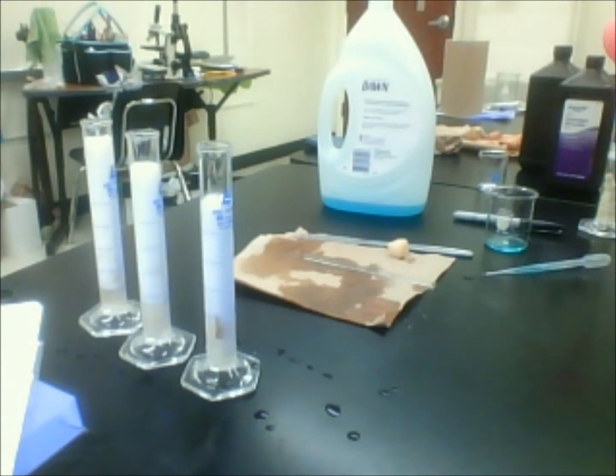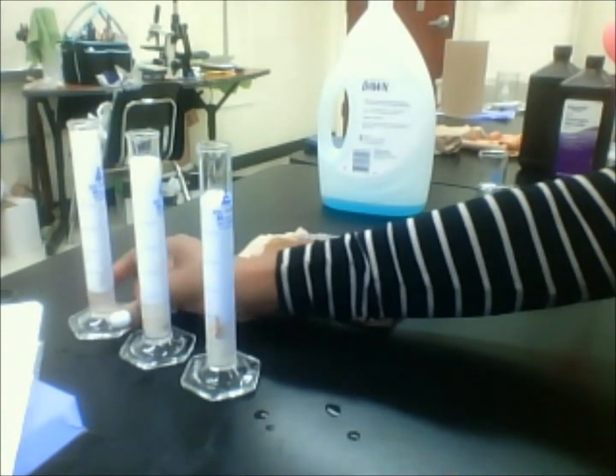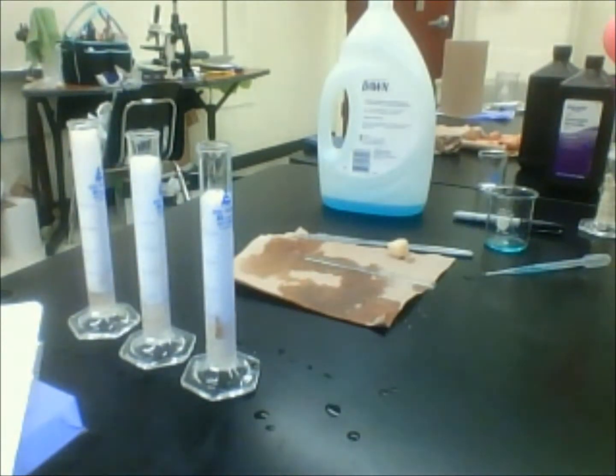All right, about 1 more minute. Oh man, y'all see this one right here that we put the 8 pieces in? It's all right at the top. All right, 30 seconds for that first one.